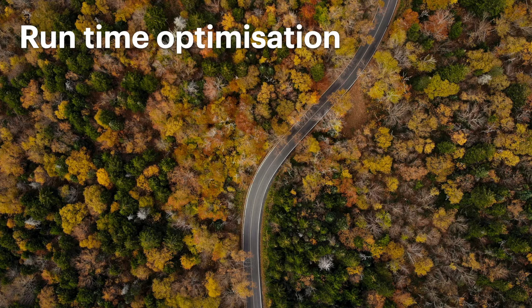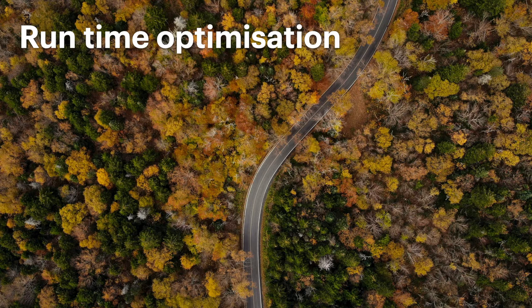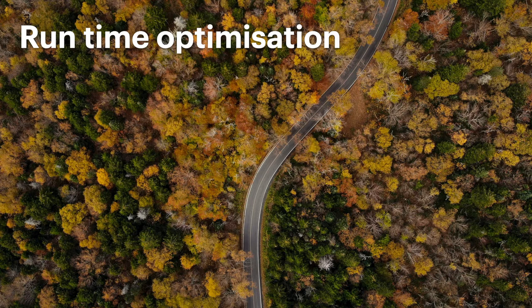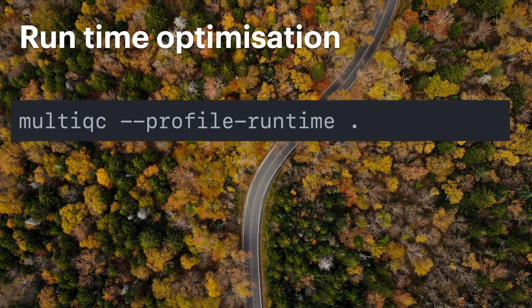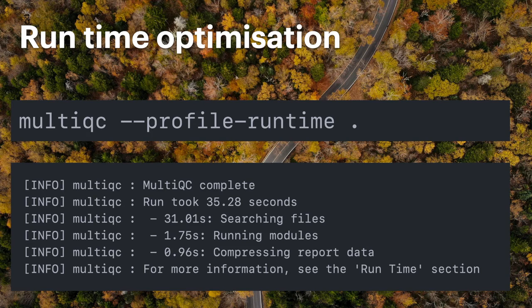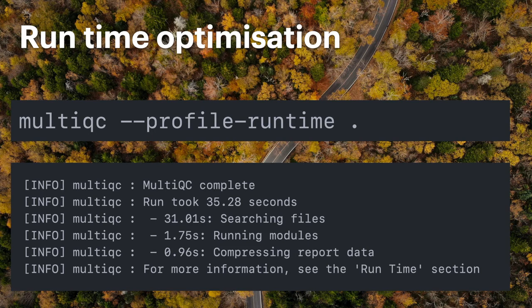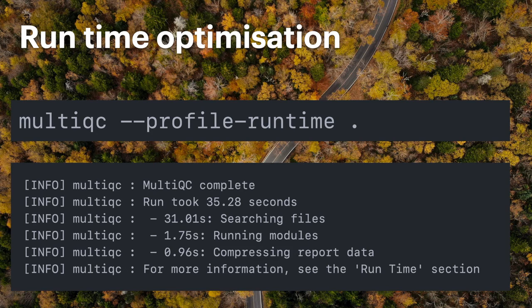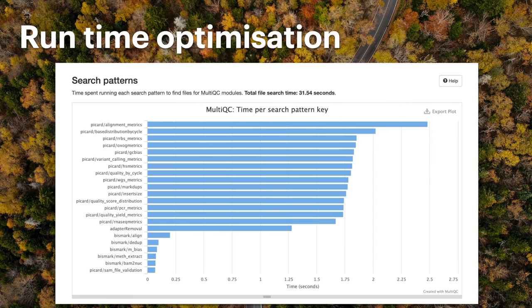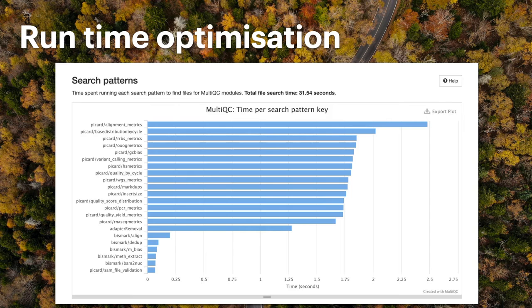MultiQC typically runs in a few seconds, so it's not the kind of tool you really need to spend a lot of time optimizing. However, if you're running with very large projects, such as single cell, or running in a pipeline which runs many times, it can be good to squeeze some extra seconds out of it. In the latest release, there's a new flag called Profile Runtime, and if you specify that, MultiQC will report how long it spends in the different parts of its analysis. Typically, the first step where it searches through the different files is the most time consuming. MultiQC will also add some sections into your report describing how much time it spent doing different things. There's quite a bit of new documentation about this, so it can really help you cut down on that MultiQC runtime if it's important to you.